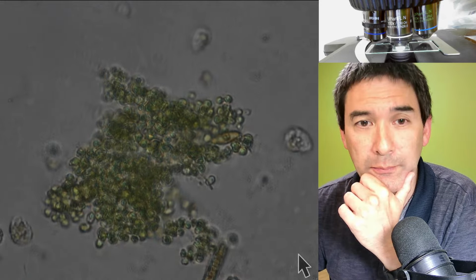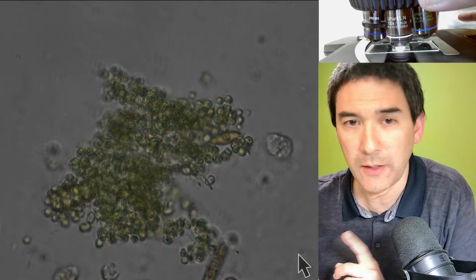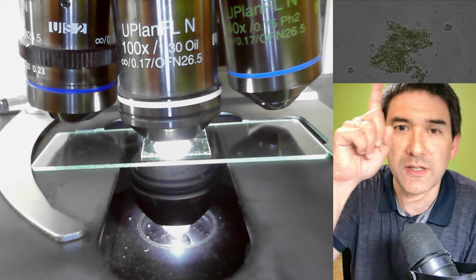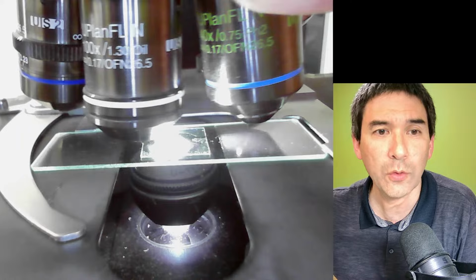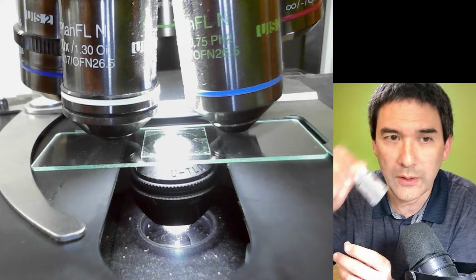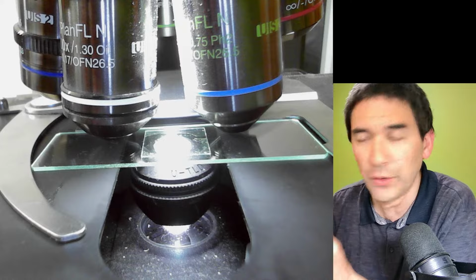Now we have to be a little bit careful. Maybe I'm going to show you this over here so that you see it a little bit better. You see a little bit in small what we've got in the microscope. I'm going to now move it over like this. It's very bright. And I'm going to now use the immersion oil. I'm going to apply a drop of this immersion oil directly on the cover glass.